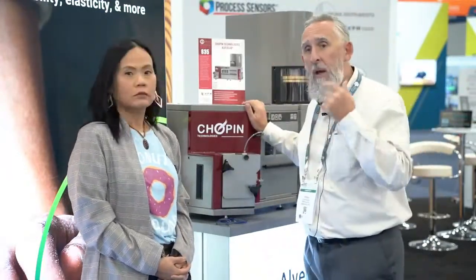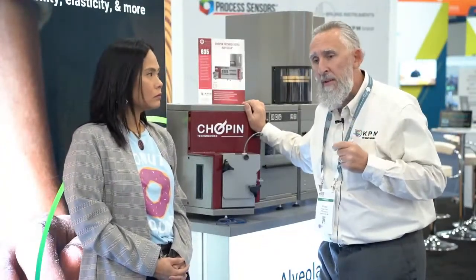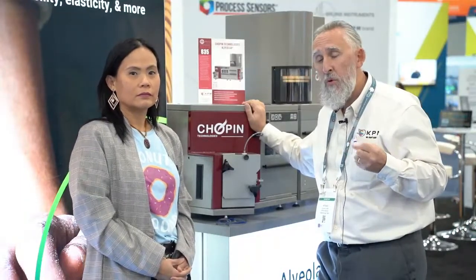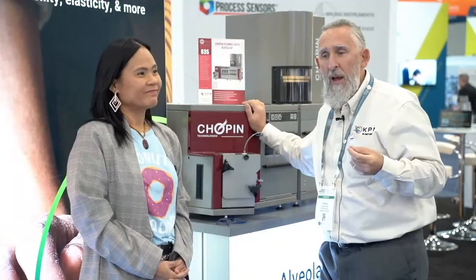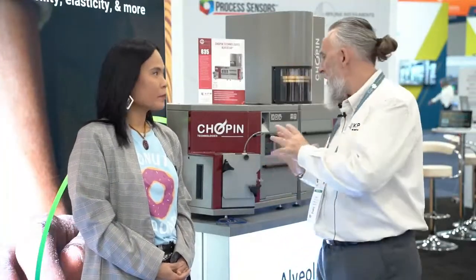Yes, this is the new AlveoLab. We have been improving a lot of features on this machine. The most recent development made it possible to do something that was impossible before — we can now analyze whole wheat flour, and whole meal flour. This is very exciting because it's really hard to analyze; if you've ever tried it before, you're bursting the bubble too early. By changing the parameters and adapting the protocol, we are now able to do something which was not possible before.